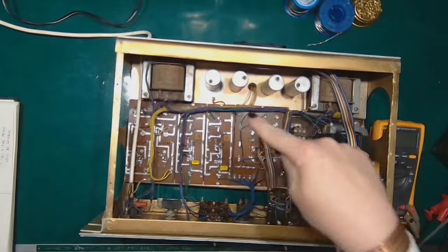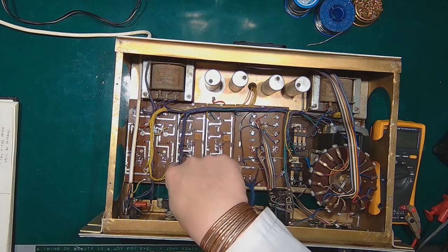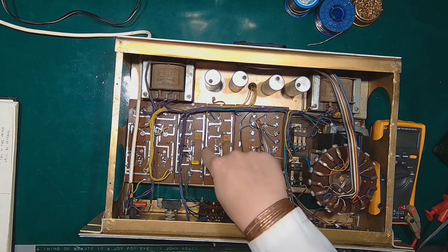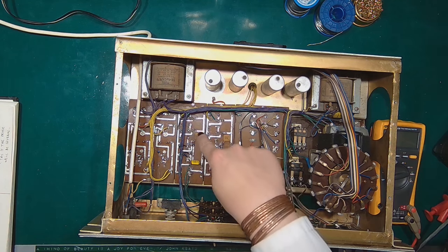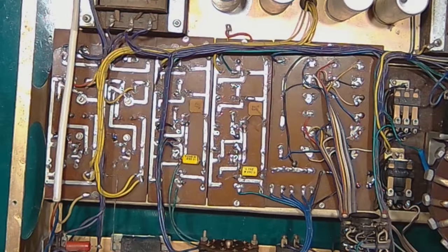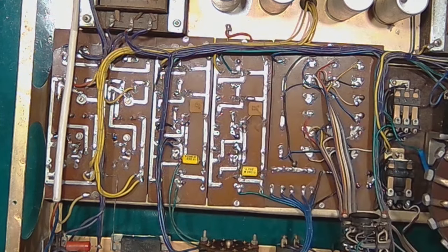And inside we've got four circuit boards. One of them is for the regulated DC power supply. It uses two lines of 13 volts. The next two boards are the timer boards controlling the relays. This timer board is for the shock duration. Let's zoom in. So this is the shock duration timer board, and this is the 100 millisecond timer board after the shock.